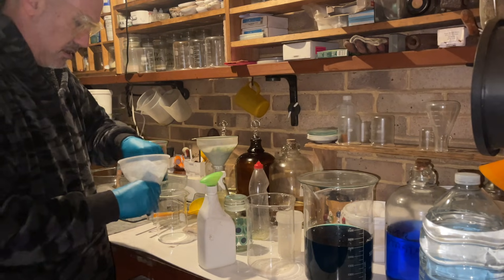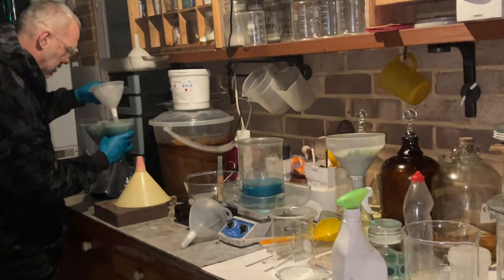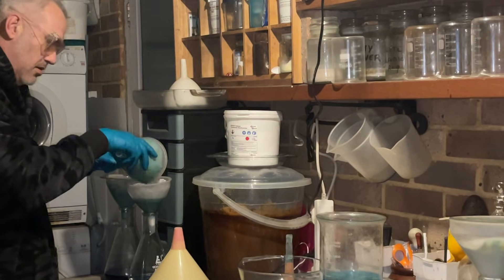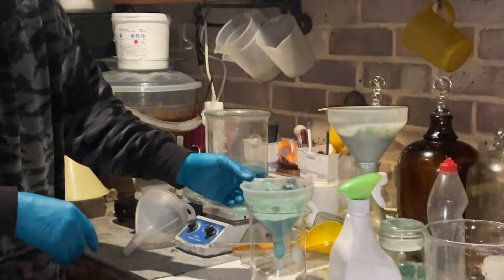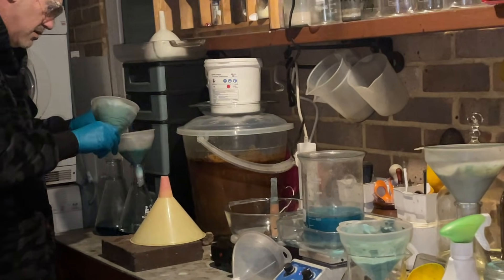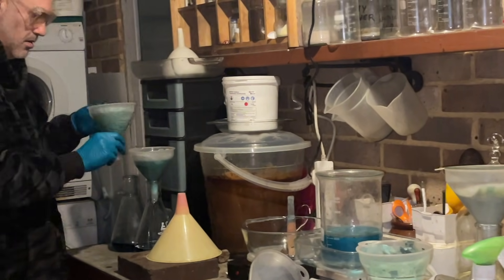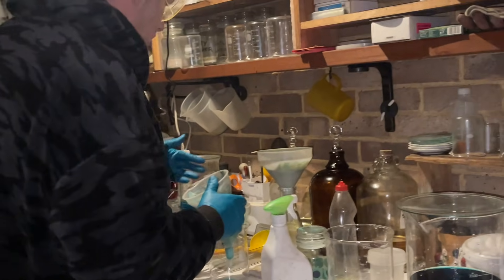These two got a little bit clogged so I'm going to swap this over with a fresh filter. That contains a gold filter so I'll put that in aqua regia. I've got another one here — we'll get them in aqua regia when we've got all the filters together.